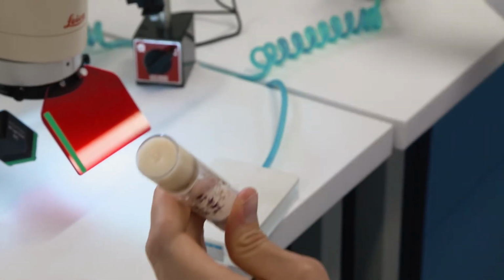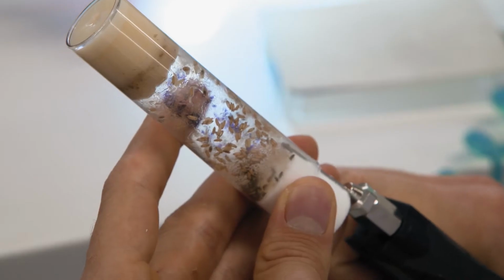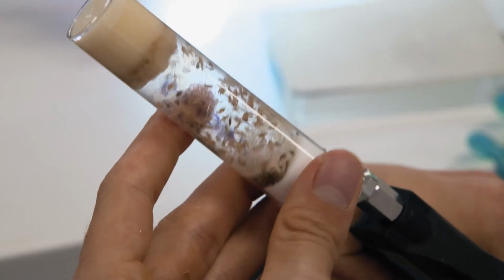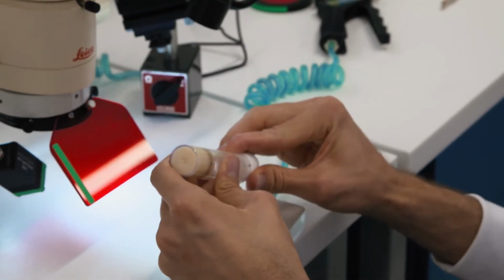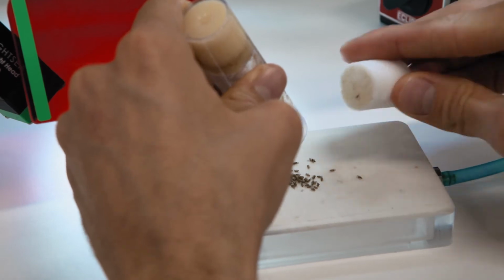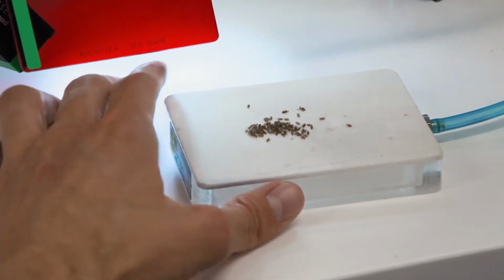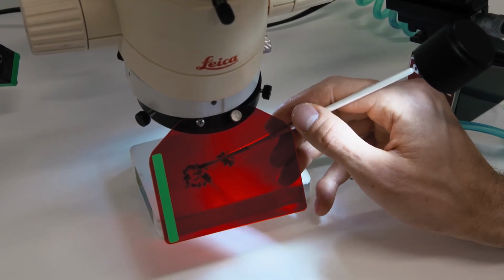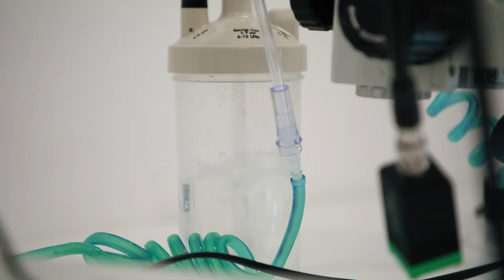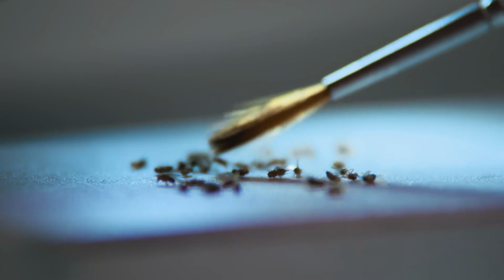And so what we were doing is we were anesthetizing the flies using carbon dioxide. They're in a little vial. And what we do is we put a little puff of carbon dioxide into that vial. And then that causes them to pass out. And then we can open that vial and then we can just dump them on this pad. And then that pad is actually porous and there's carbon dioxide that's coming up from underneath that. And so that is supplying enough carbon dioxide to keep those flies unconscious while we work with them.